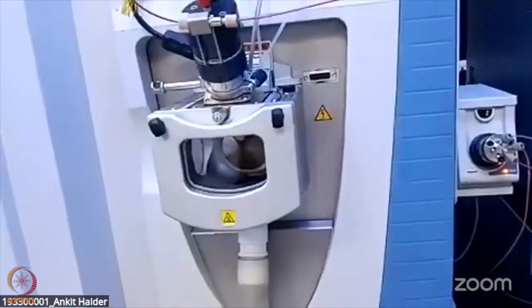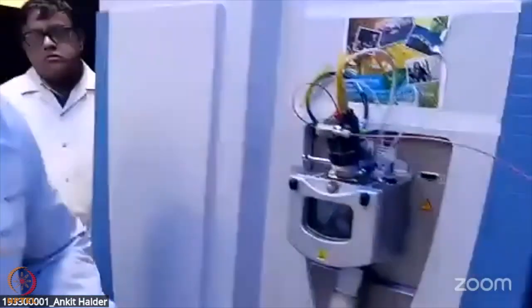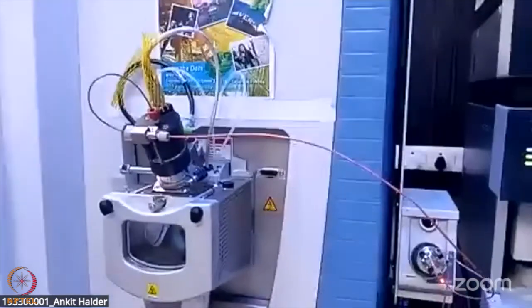Amit, I think going into HESI-2 probe is going into more detail than the time we have. Okay, thanks for this demo.